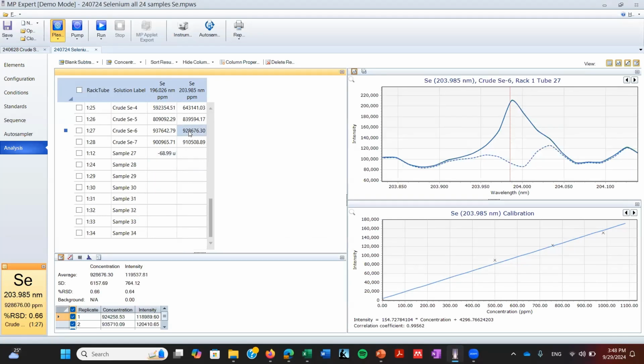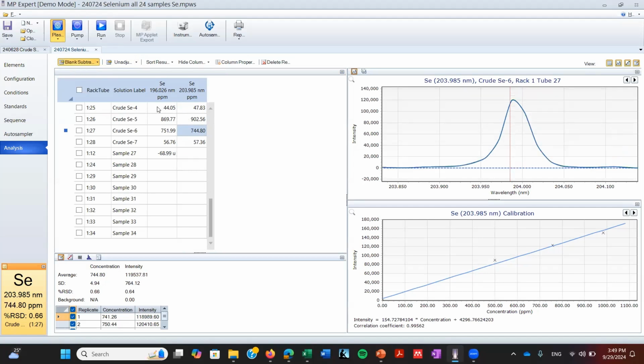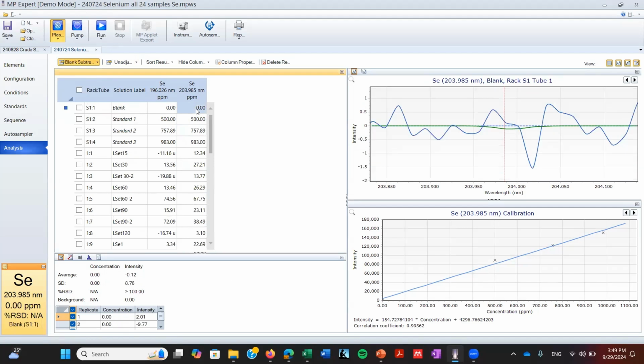Now, how can I get even better results? Because right now we just know that this is acceptable data because it's above 500 and below 1000. But something that we can do is the following. We can go to blank subtraction, and it's usually turned on by default. So if you see here, this is the blank. We expect it to be pretty much 0, because it's below 1 intensity.